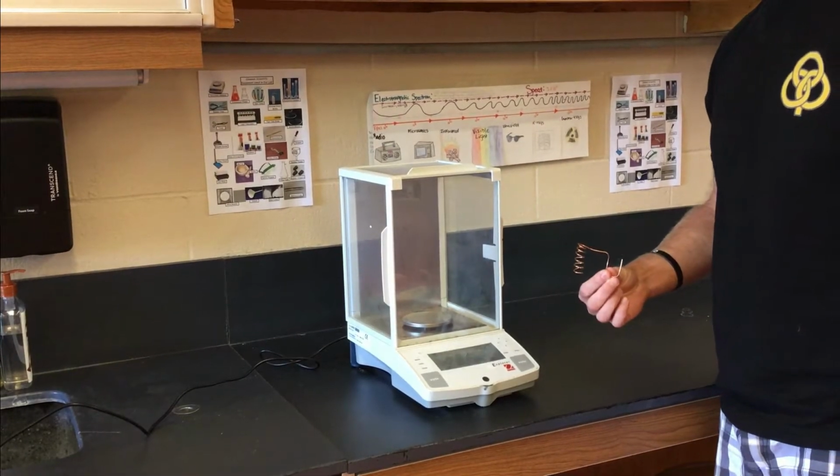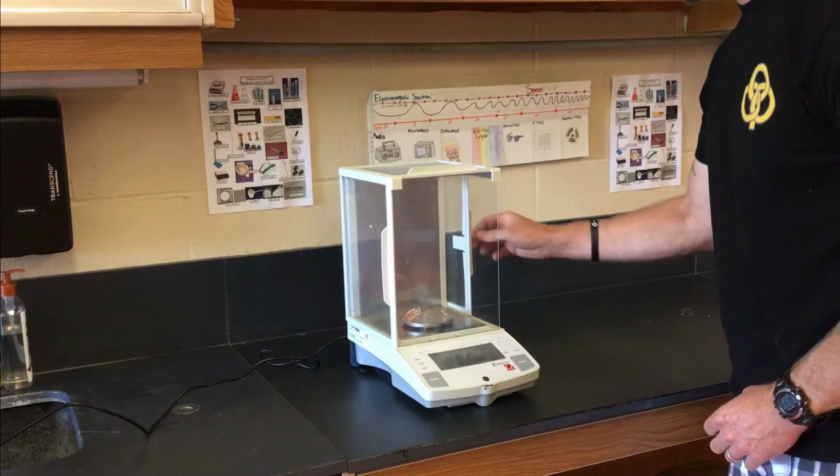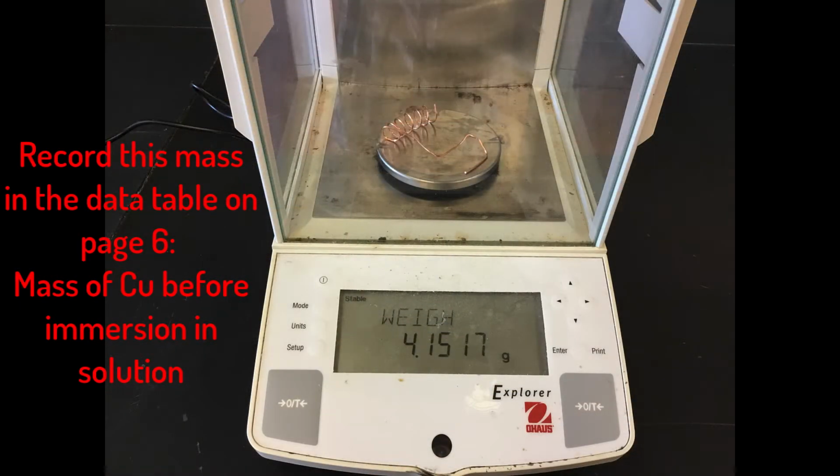After getting your goggles and setting up a paper towel placemat, it's time to get a piece of copper wire and mass it on the electronic balance that reads to the 10,000ths place. Record that mass in the data table on the top of page 6.